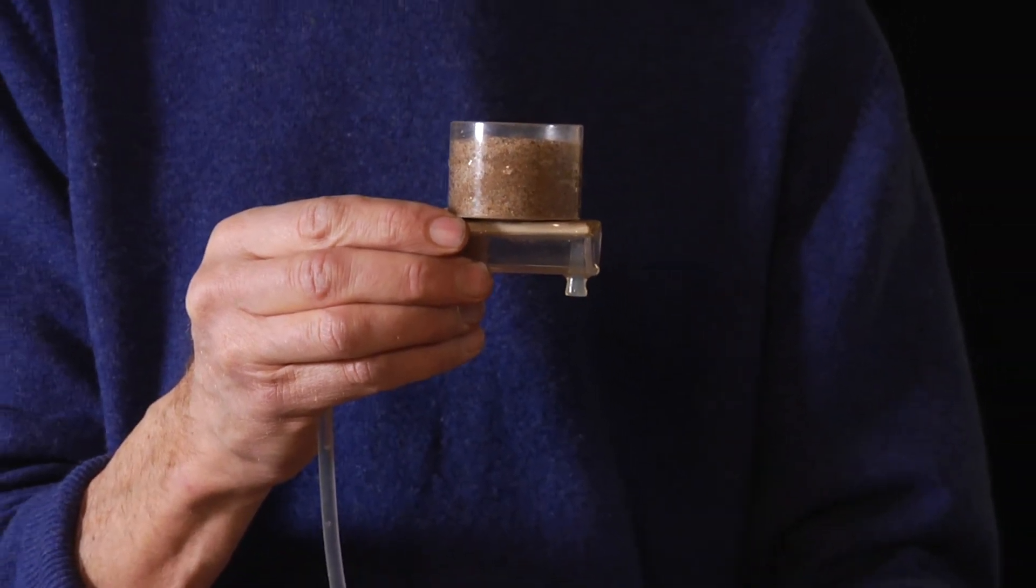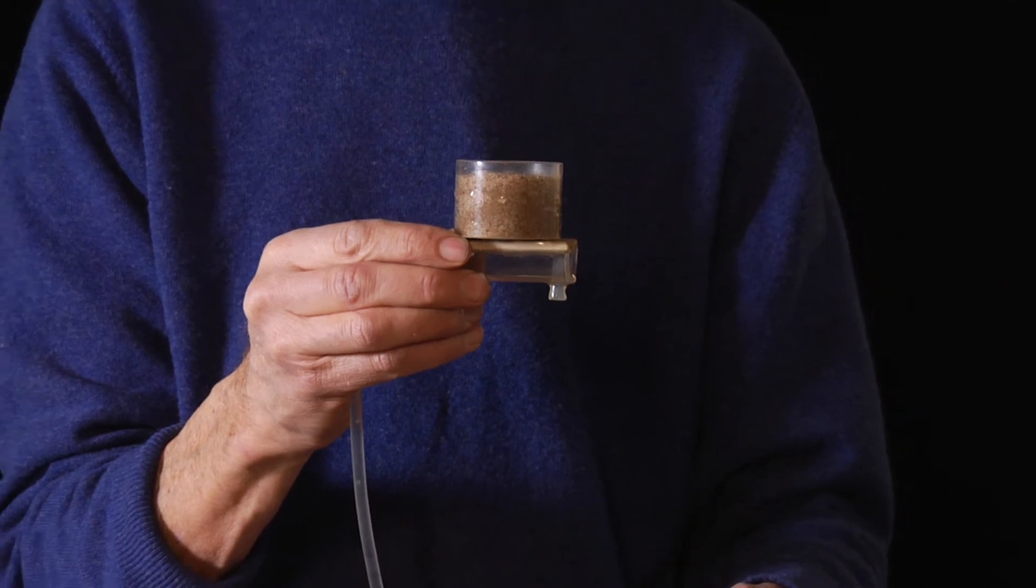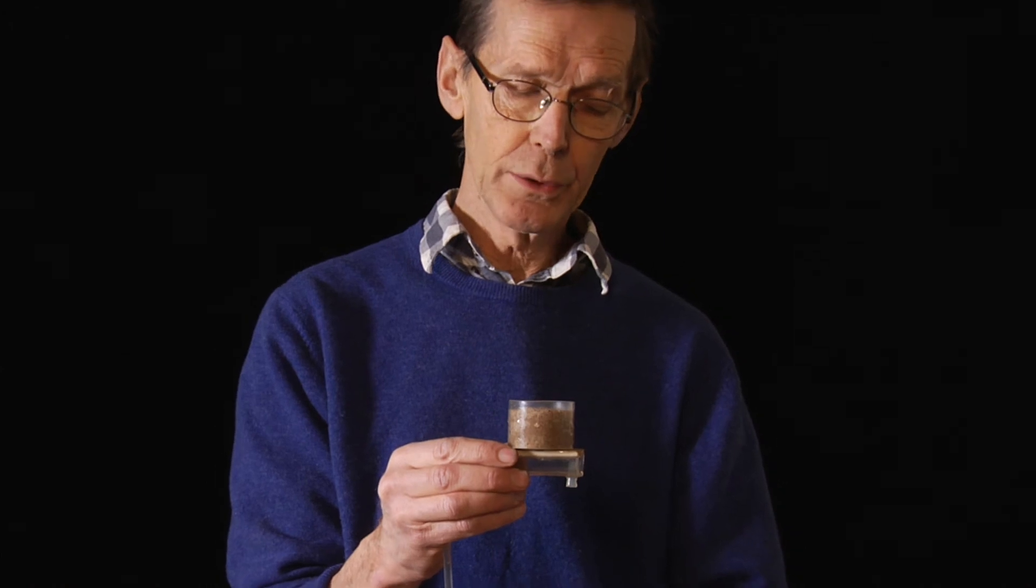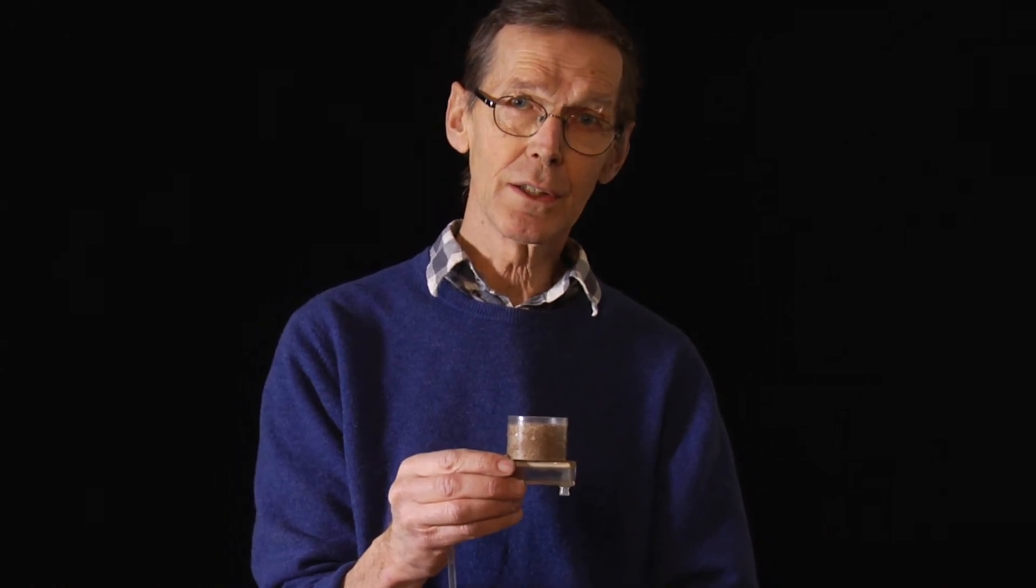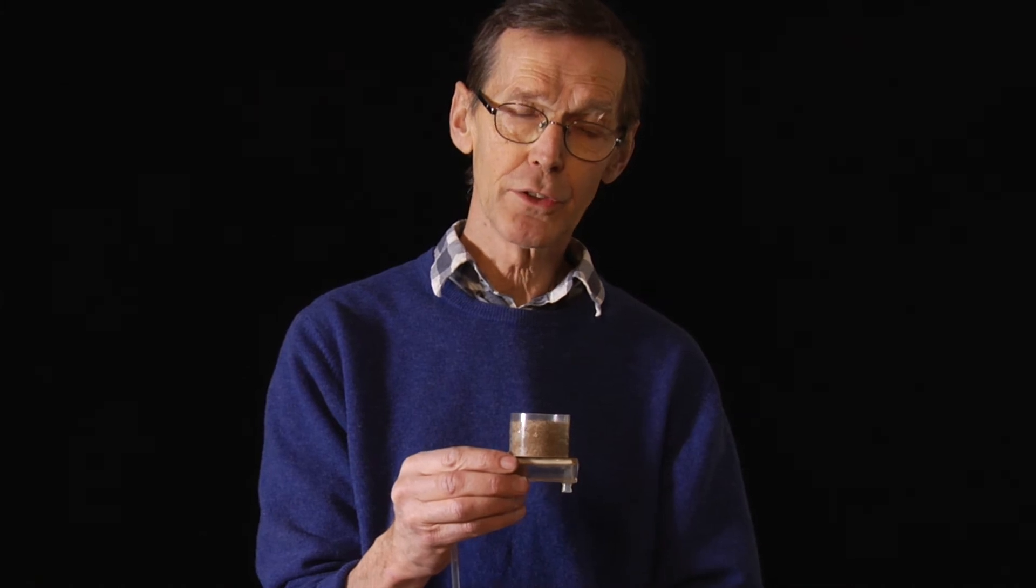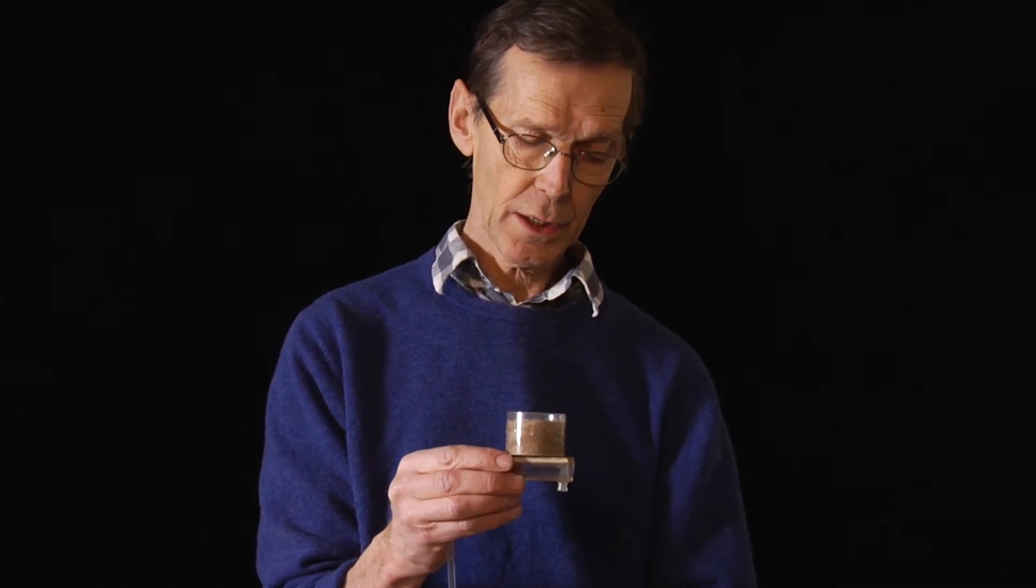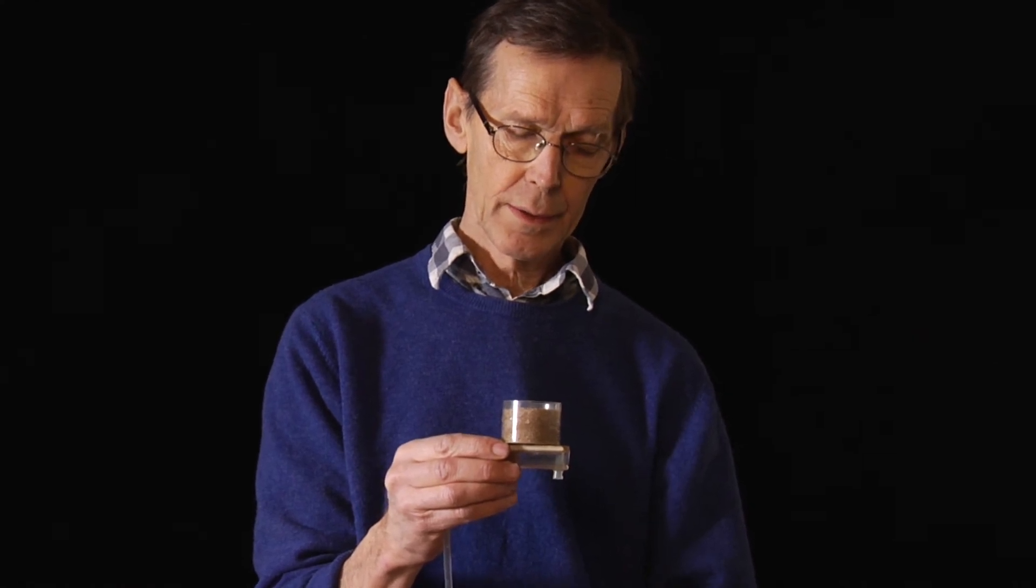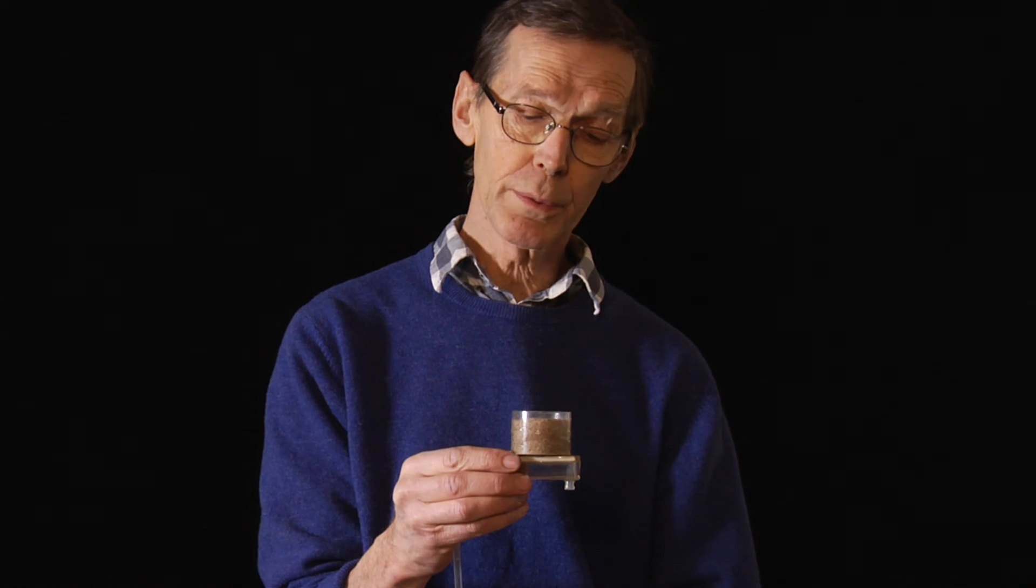In this way I can continue. If I wait and measure how much water is drained at each new level, I can calculate how much water the soil can retain against different negative pressures. In this way I get the relationship between water pressure and moisture content, the water retention curve, which is a very valuable characteristic of the soil.